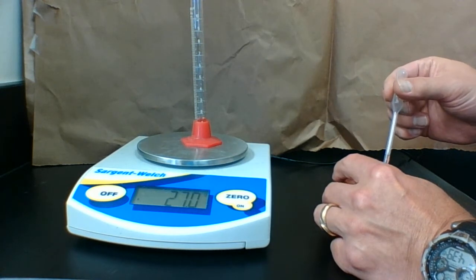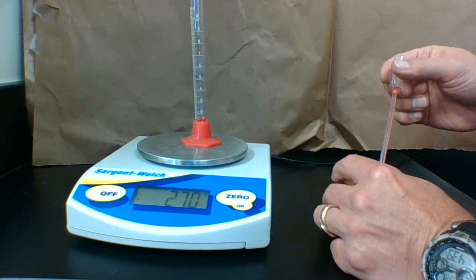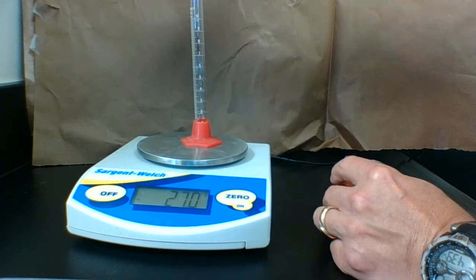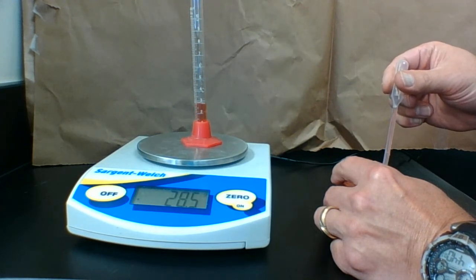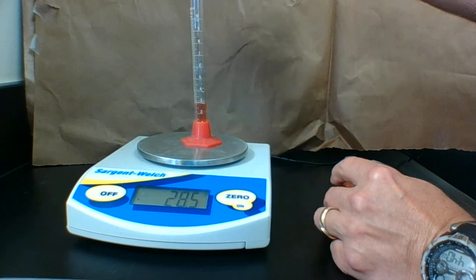This pipette doesn't hold a lot so I'm going to have to do it a couple of times. I'm going to put in a desired amount, but again it doesn't hold very much. I'm doing it slowly so I don't spill it.